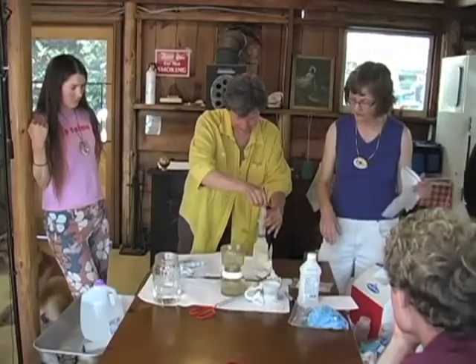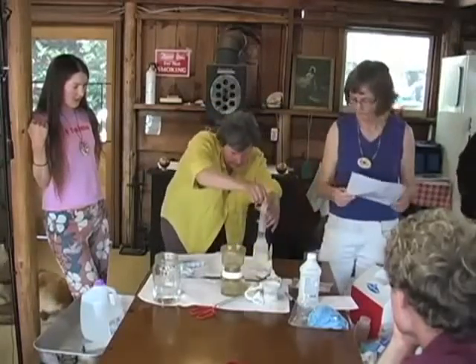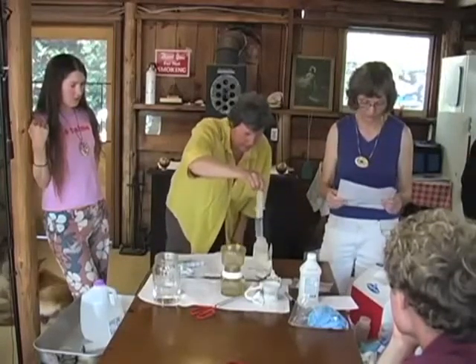This is your creek water. Irrigation. Which sample was this? This is your creek water. Creek or lake? How many mils do you want to draw? Pass Creek, Pass Lake. How many mils do you want to draw?